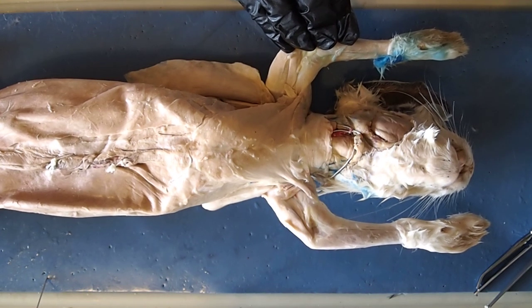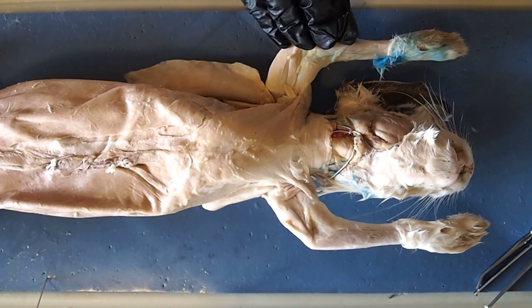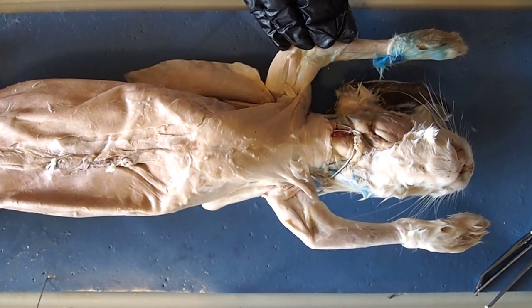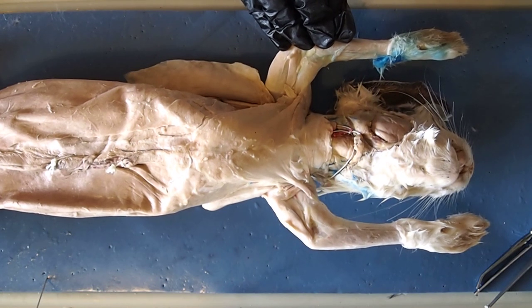I have posted a lab document that has all of these muscles that are going to be pinned, for you to refer to. Hopefully you can go back to the video as I point through these different muscles and talk about them, so you get a better idea of what we would have done had classes been going according to plan.